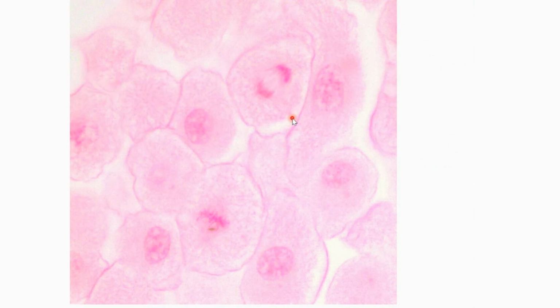I think this is actually the picture that you guys did with your group. So remember we said these were the anaphase cell, because the genetic information is being pulled away from each other. And there's that metaphase cell with the line of chromosomes in the middle, and then a whole lot of prophase cells around it where that genetic information is clumped.